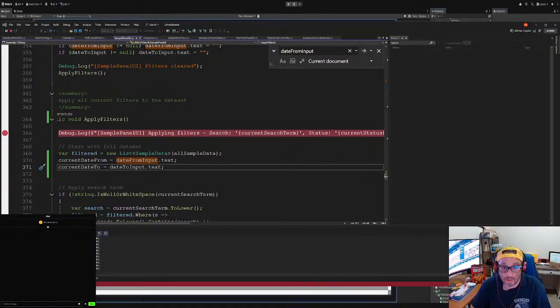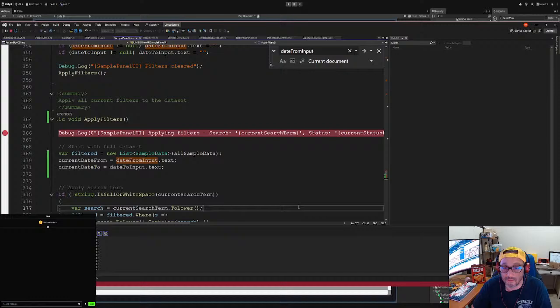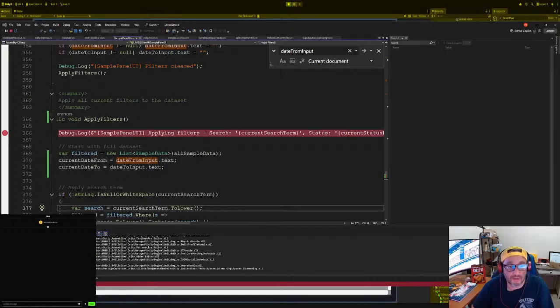Get rid of that. Say UI input date. Bring it here, and then just so it doesn't crash, we could test this scroll view, and then we want to add that to the date as well, even though we're not using it. All right, so not using it right now. We'll fix all this stuff later.